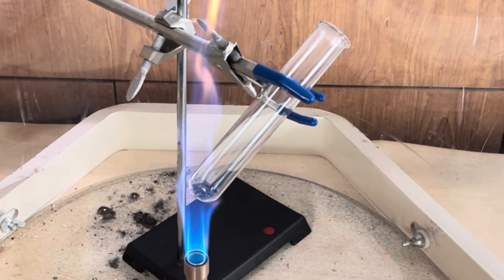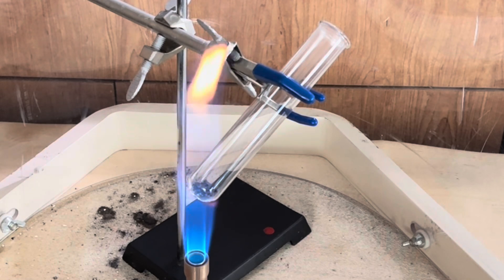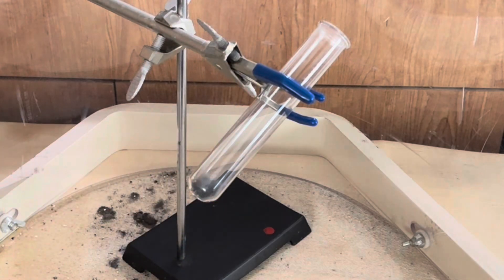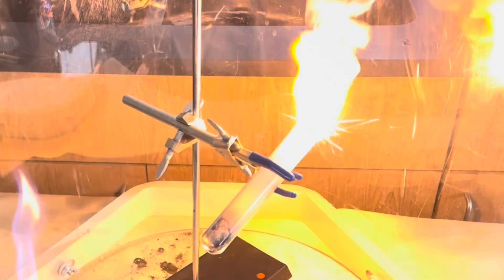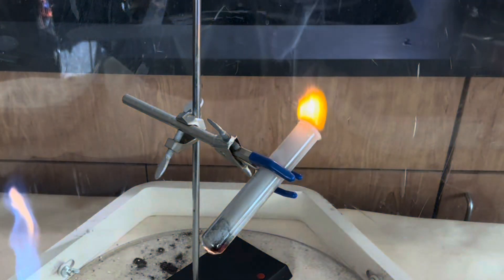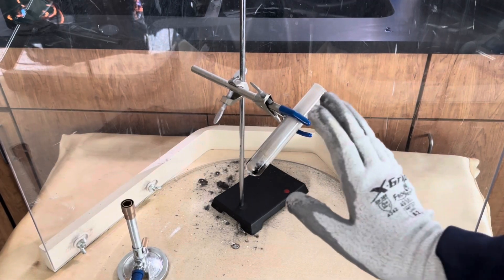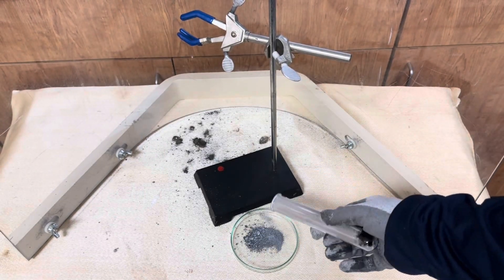Right now it's starting to create magnesium oxide and silicon, which will then react to create magnesium silicide. The next step is to let this cool for a few minutes. Once your test tube is cooled down, you can tap that magnesium silicide into a petri dish.